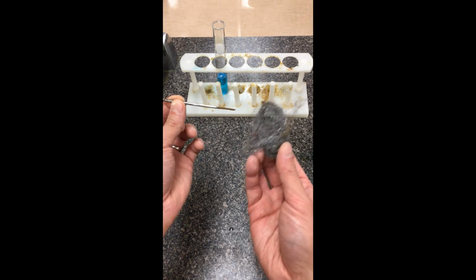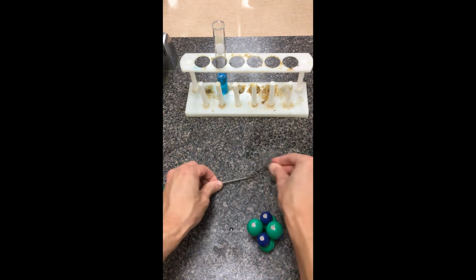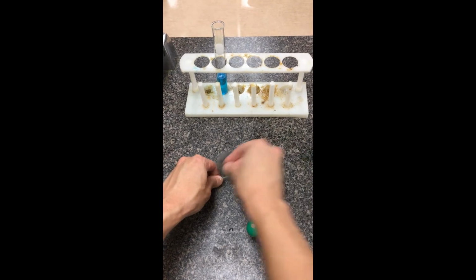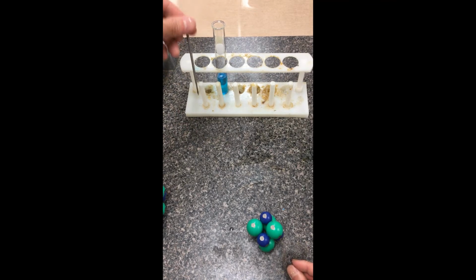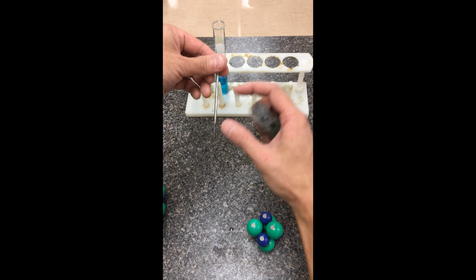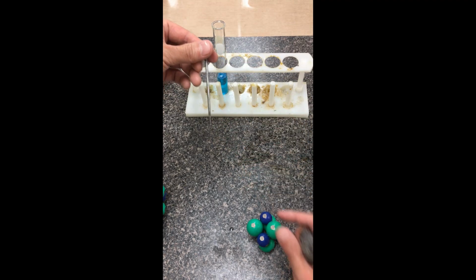So what I'm going to do is take a piece of steel wool. It acts sort of like sandpaper. You can just scrape down some of the outsides here. You try to reveal as much of the iron as you can so that the iron is exposed to the copper sulfate solution when you drop it in. The hope is, because the nail is fairly long, as I drop it in, part of it is going to be covered in solution and react, and part of it is not going to react, and that way we can compare the before and the after.